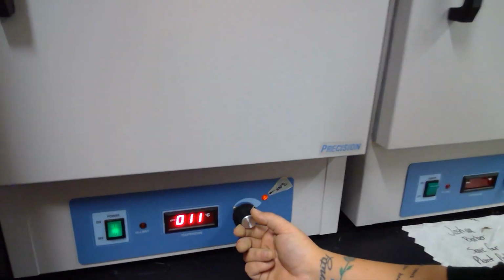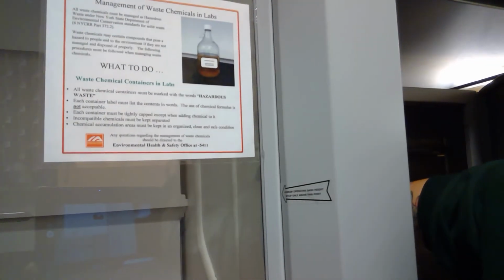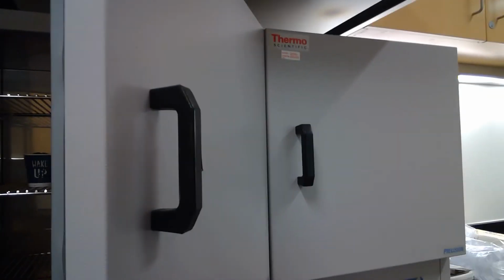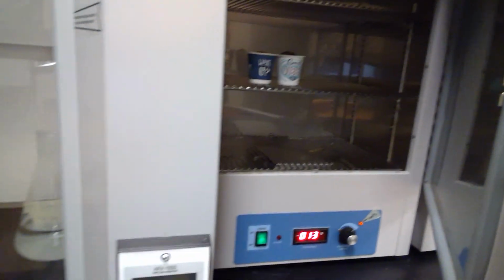So I'm going to see where that gets me on the dial. Open this up. Put my 1st cup in there. Put my 2nd cup in there. There they are.